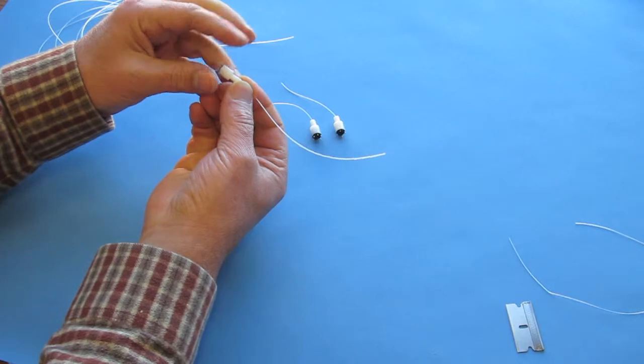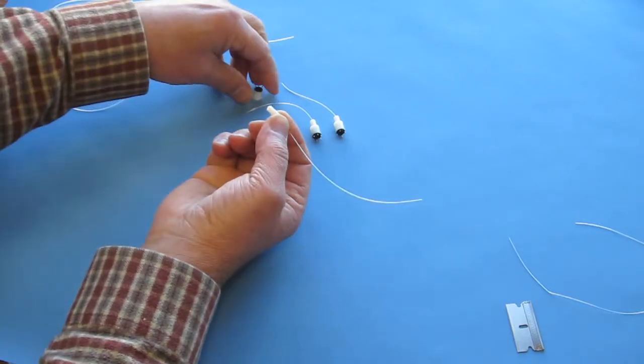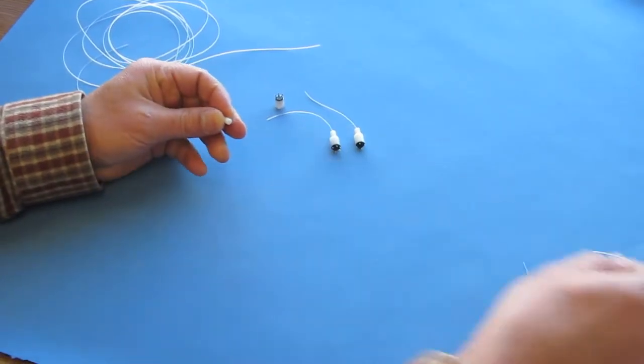The first step is to remove the tail section of the manifold by turning it counterclockwise until it's free from the body section.